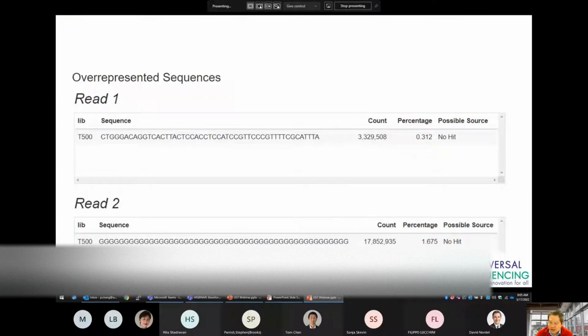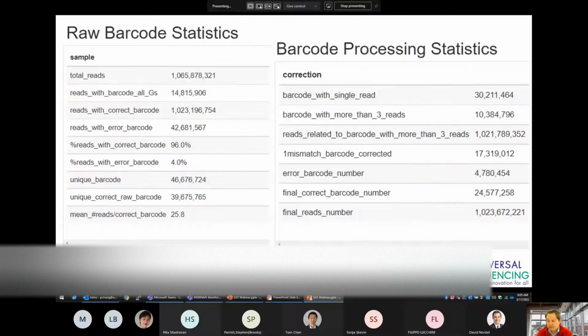The analysis also identifies overrepresented sequences. We usually expect some level of these sequences, but here they account for only 1 to 2% of reads, which is not really a cause for concern. Often if you have adapter sequences or high amounts of technical contaminants, they will show up here, but any percentages under 2% is not a cause for concern.